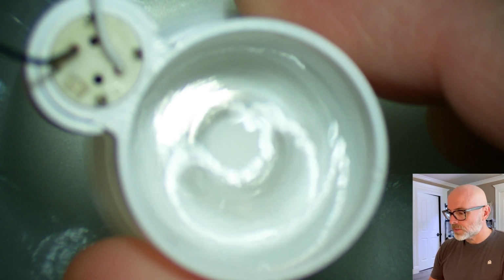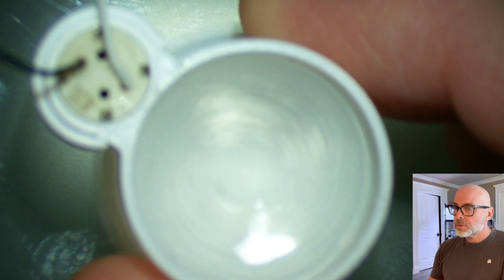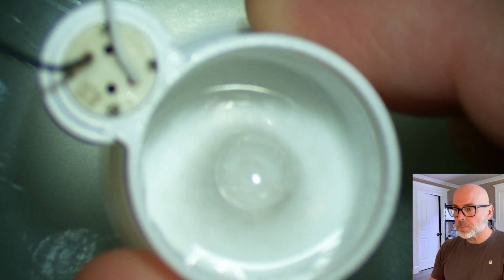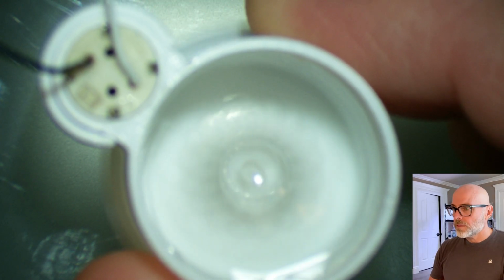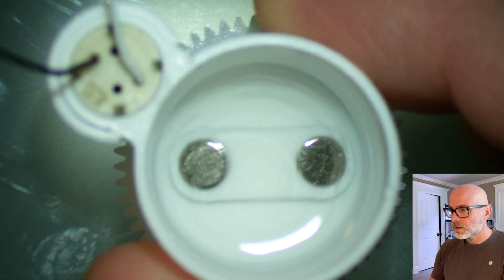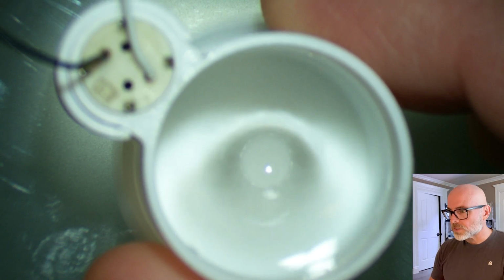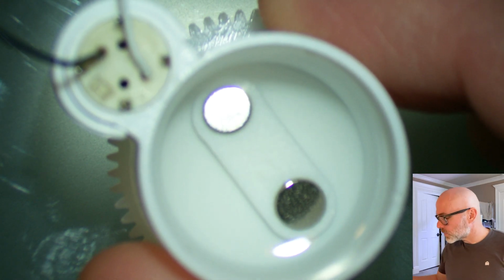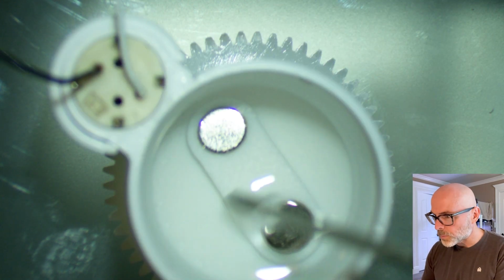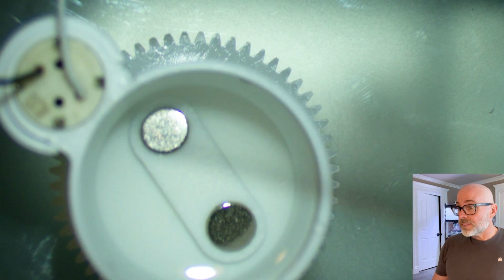I'll figure out the exact best RPM for this. So it's spinning, and this will likely be continually spinning during the experiment. And as we stop it, and this is again the worst case scenario, as I'm moving the needle around, it just looks like water, but just happens to be much more viscous. So it's well mixed. That should work well.